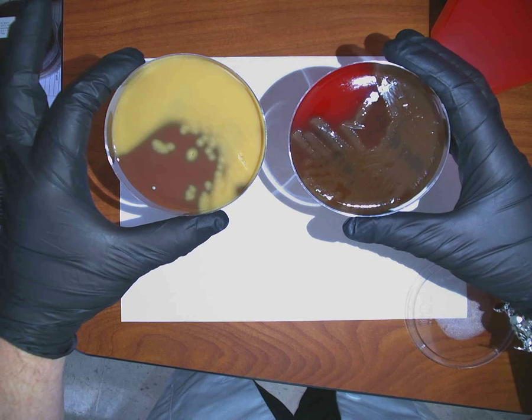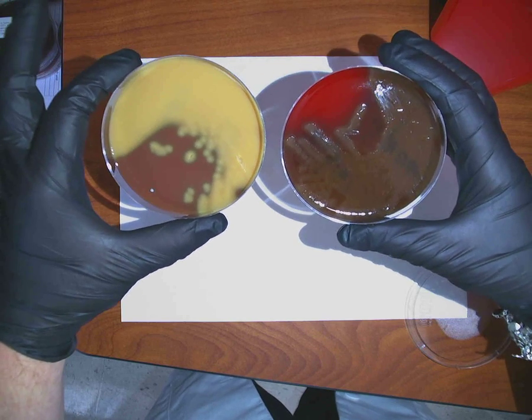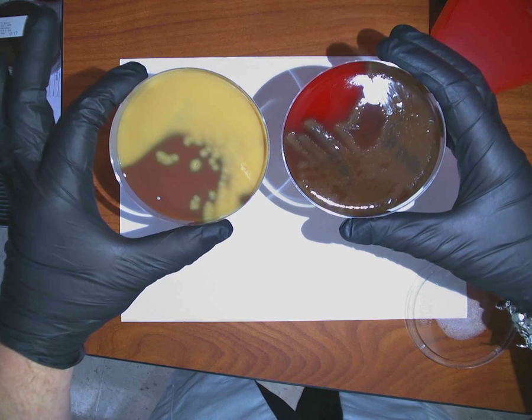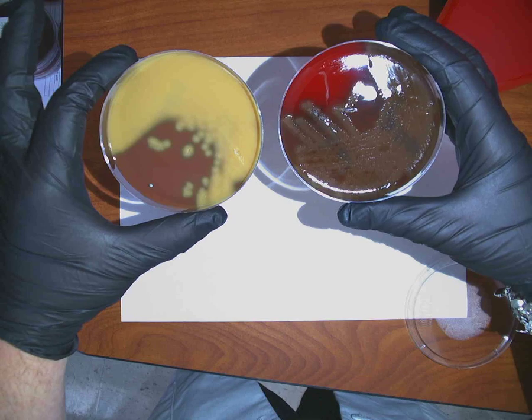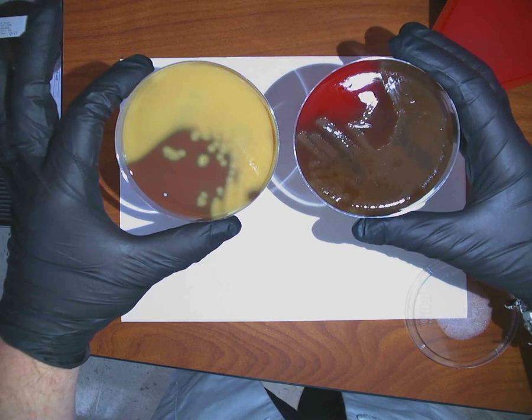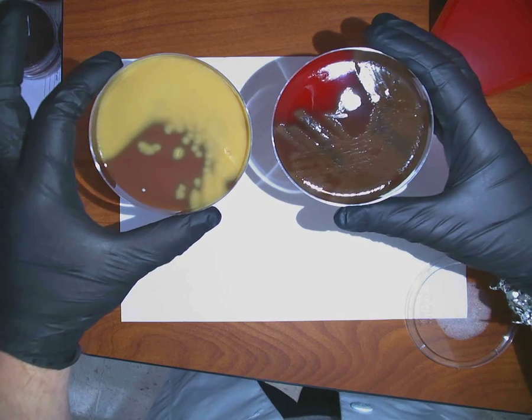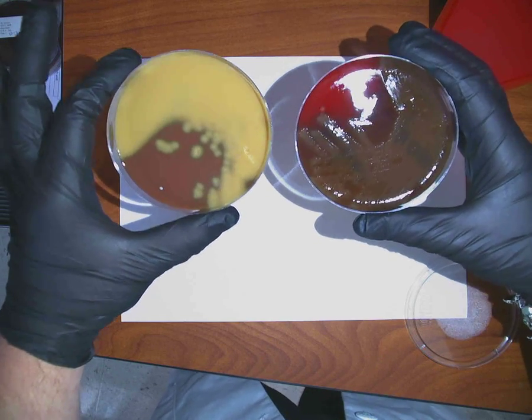So that leaves strep, right? So I'm pretty sure that this is in the Streptococcus genus. But based upon the alpha hemolytic pattern, what do I need to do next? What's the first step in identifying? Catalase, okay? We can't jump right to a P disc because we have to go in a progression. So catalase is the first one, although I'm fairly certain it'll be catalase negative. I need to check it. So yep, catalase is the first one, and it is negative.